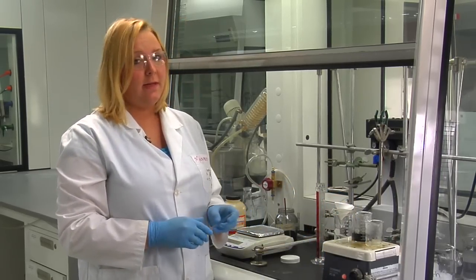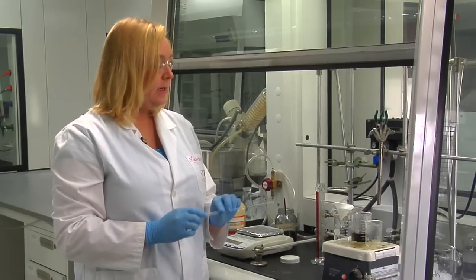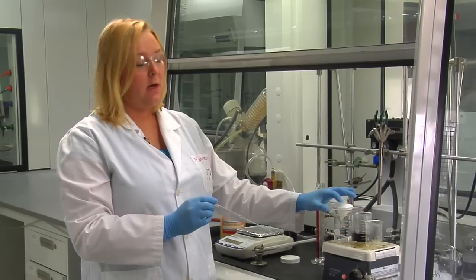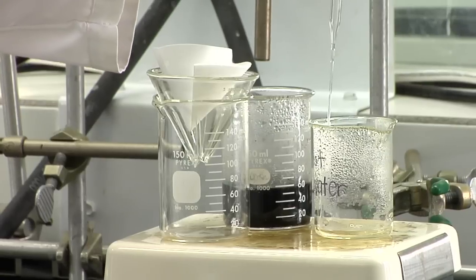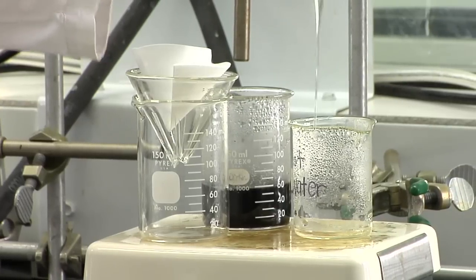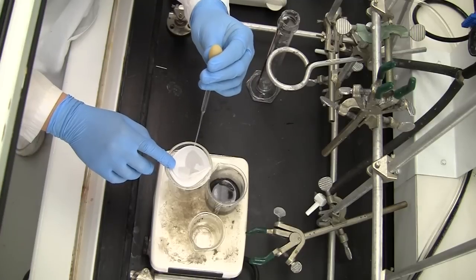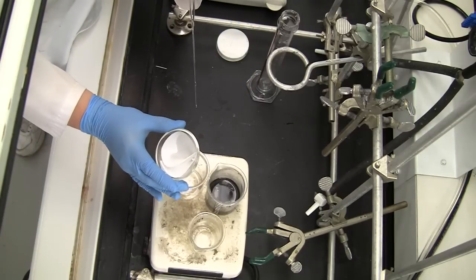Then using some of the hot water that you still have on your hot plate, you're going to wet the filter paper with this hot water, so that when we pour our solution in, the salicylic acid stays in solution. So just put a little bit of hot water around the funnel like that.